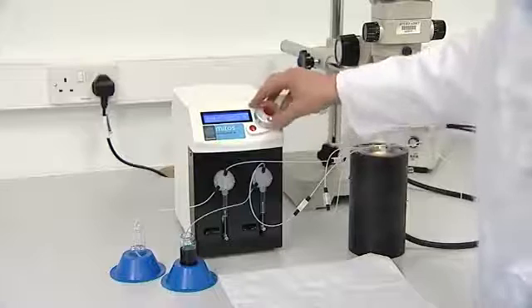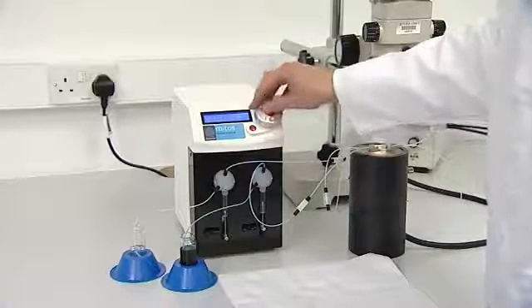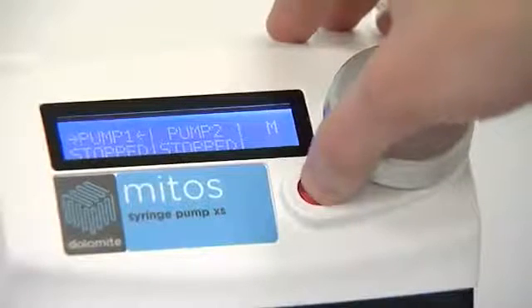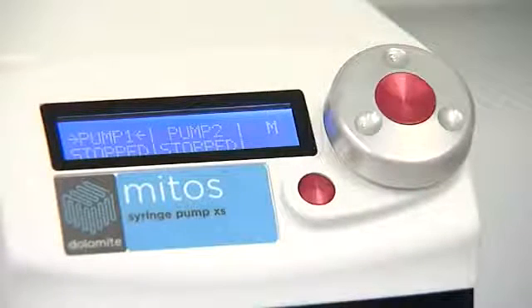Now that the fluidic system is complete the pump is switched on, either from the front panel or controlled by a PC. Fluid is pumped at the desired rate. The Mitos pump handles two independent channels simultaneously.